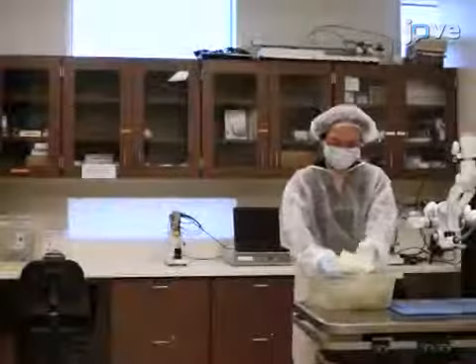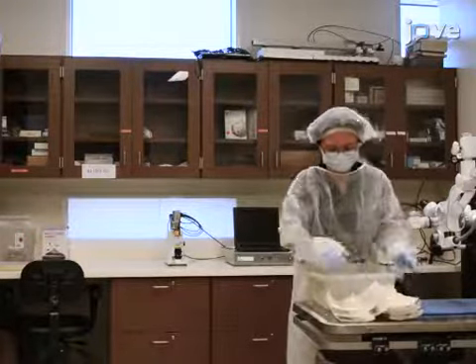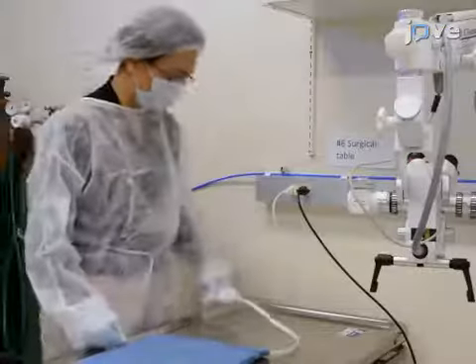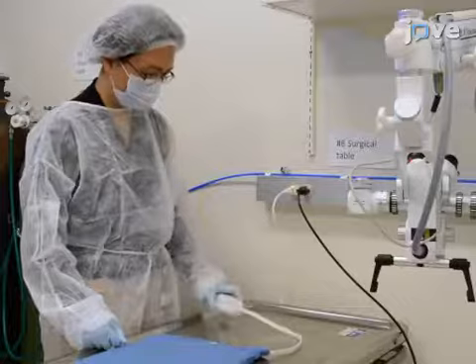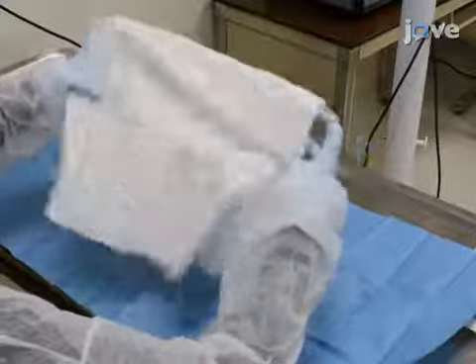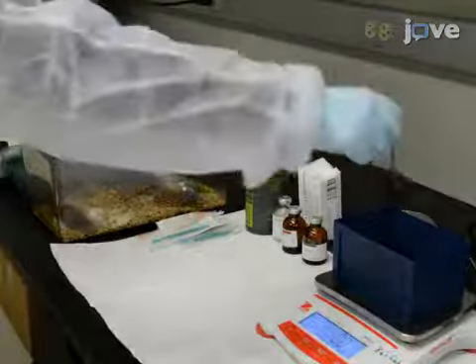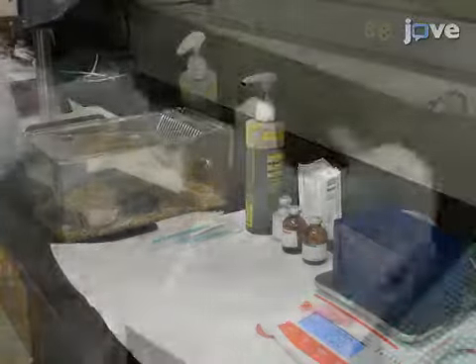Begin by bringing the autoclaved surgical instruments and metal spine stabilizer to the clean surgical table. Warm a heating pad to 37 degrees Celsius. Then place the heating pad on the operating table and cover with sterile surgical drapes. 10-week-old female C57BL6J mice are used for this study.